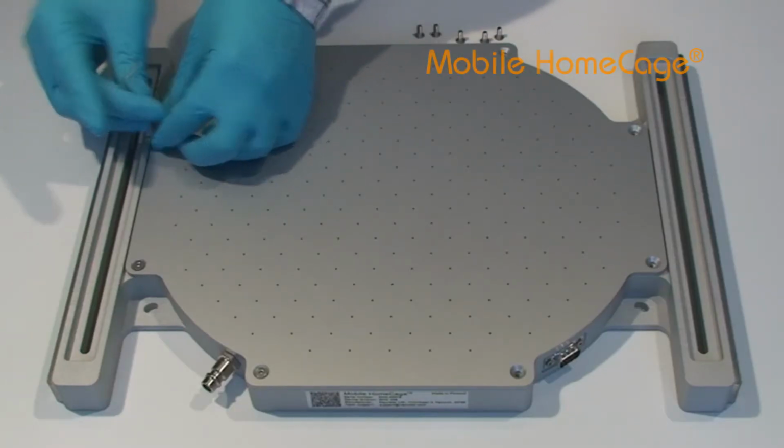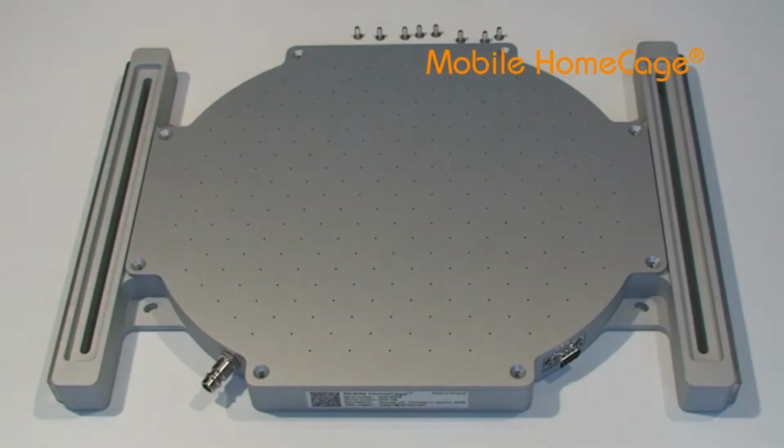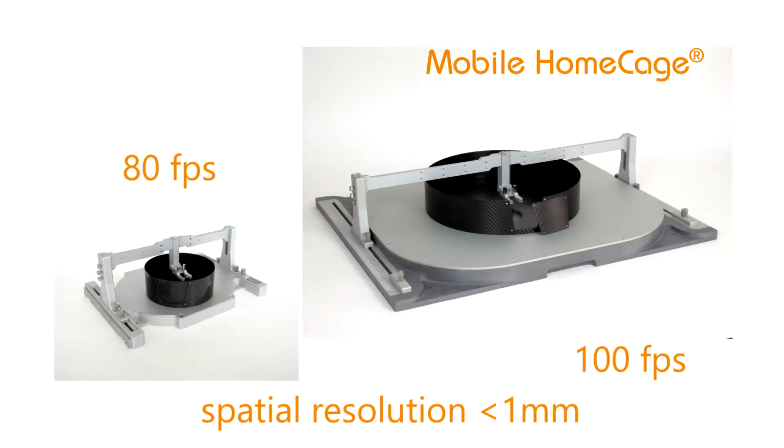The magnetic tracker is built into the Mobile HomeCage, so it doesn't take away valuable space in the two-photon microscope setup. Unlike camera-based trackers, the magnetic tracker works both in light and in dark conditions. And, depending on the device model, it gives 80 to 100 frames per second, which is much faster than image-based tracking algorithms. Both regular-size Mobile HomeCage and the Mobile HomeCage Large use the same open-source software.